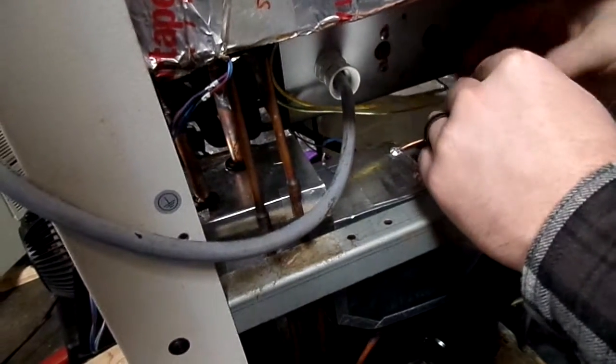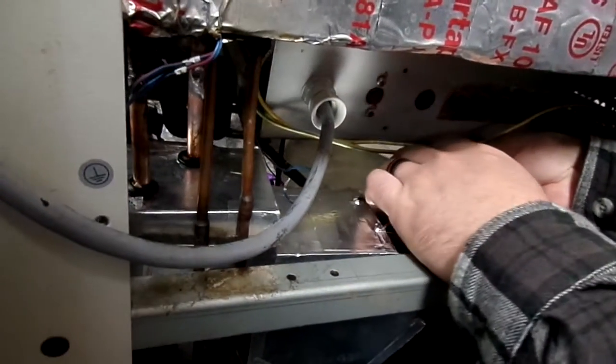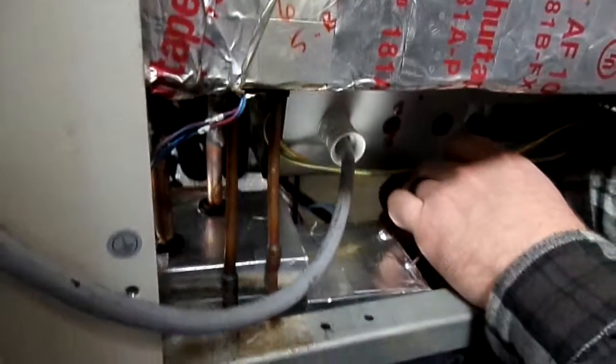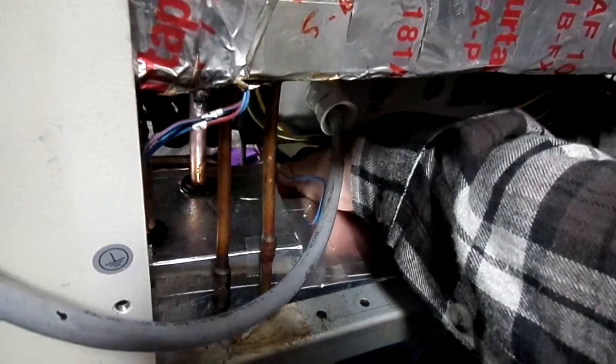This guy. Back over here. You don't want to kink these, obviously, because they won't work. And Jesse providing some soundtrack. I like it. Drum roll. A little drummer boy over here. And then that'll go about right there. Again, leaving the actual capillary tube that goes to the valve higher than, it's not at the bottom of the valve, or the bulb.